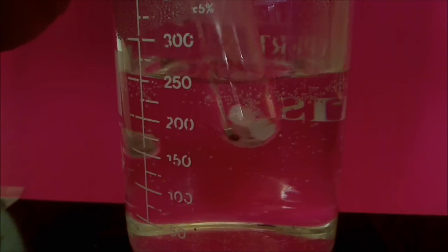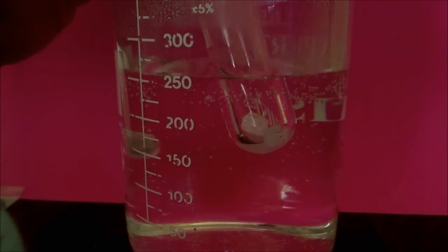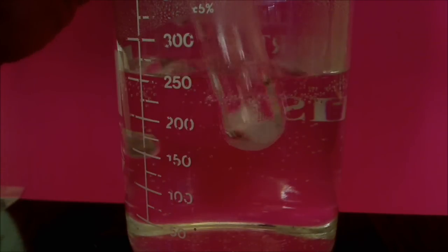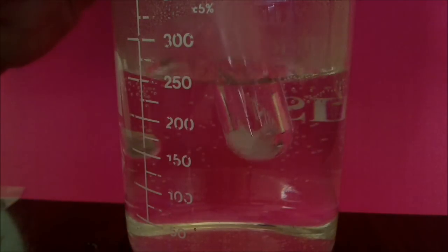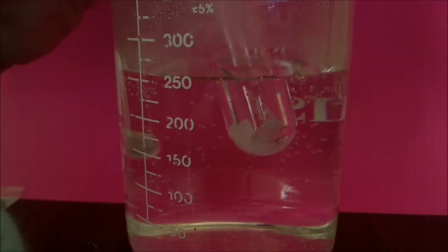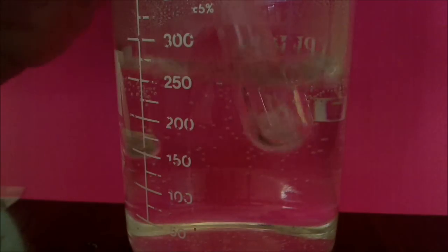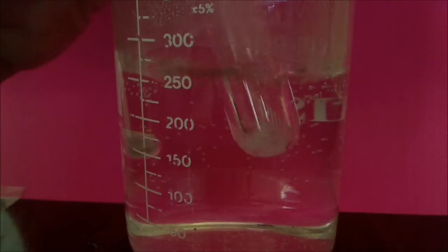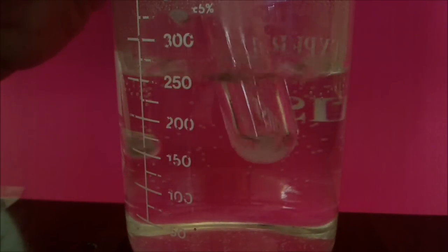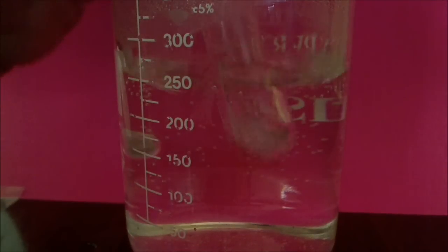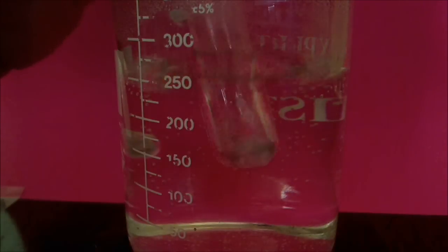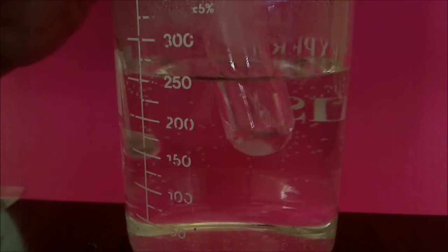As the temperature rises to above 53.5 degrees, you can see the crystals melting. And it forms a liquid. This occurs at a specific temperature, the melting point of paradichlorobenzene, which I said is 53.5 degrees. You can see the crystals are almost completely melted. Give it a little agitation. The temperature of this mixture of the solid and liquid is 53.5 degrees.